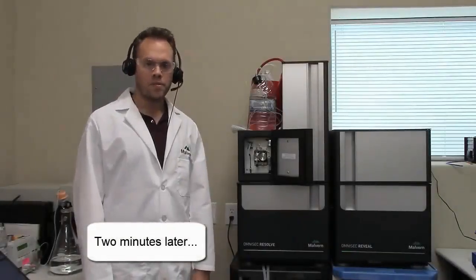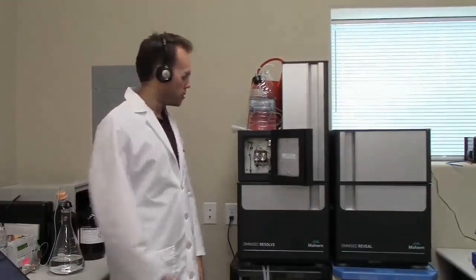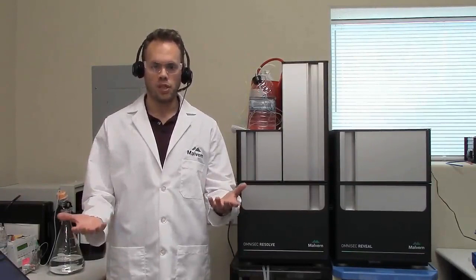Okay, so the pump has finished priming itself, and we've now flushed out the degasser and the pump with just pure water. So we're going to close the purge valve, close the door. Now there's no viscosity difference, or a very small viscosity difference, between the PBS and the water. So flushing out the detectors we can do at 1 ml a minute. There's no chance of any salt precipitation or anything in this situation. We're washing out the salt, so we can afford to do that relatively quickly.